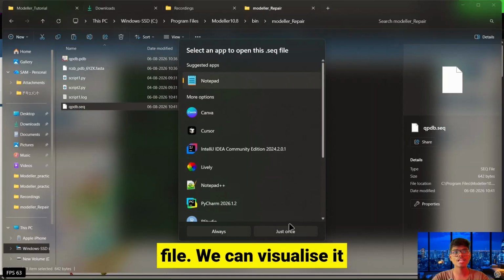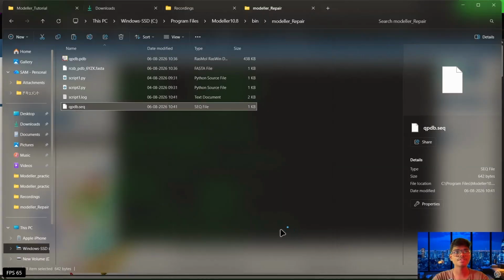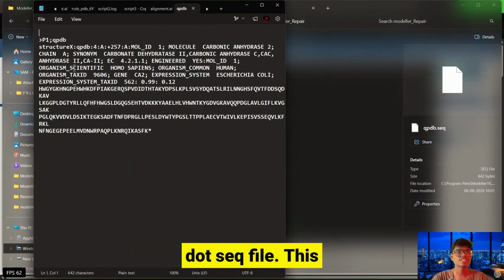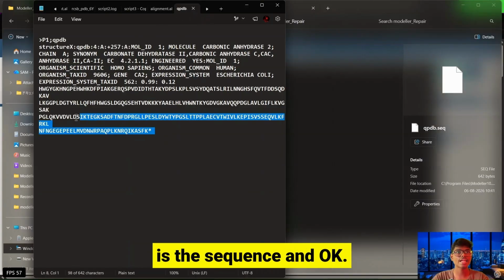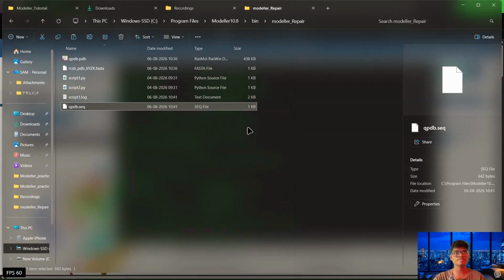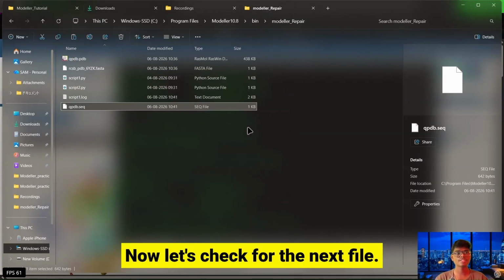So let's visualize the qpdb.seq file. We can visualize it using Notepad. So this is the sequence of the .seq file. Okay, now let's check the next file.